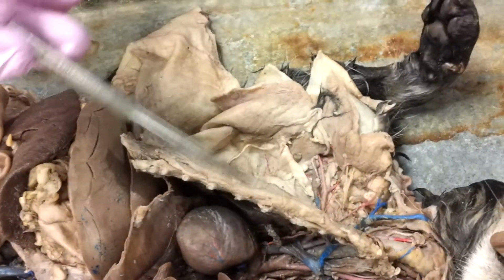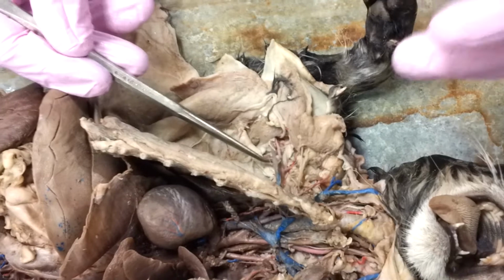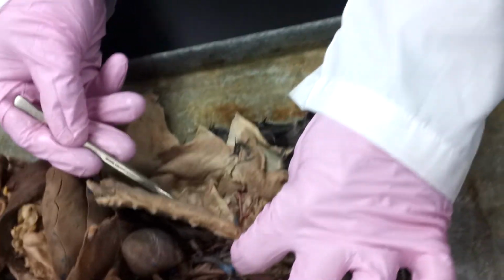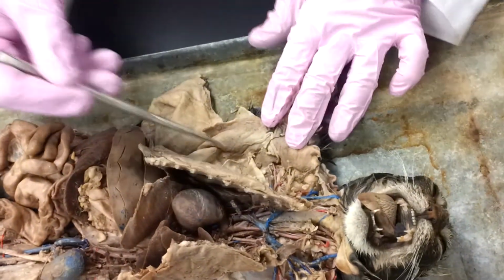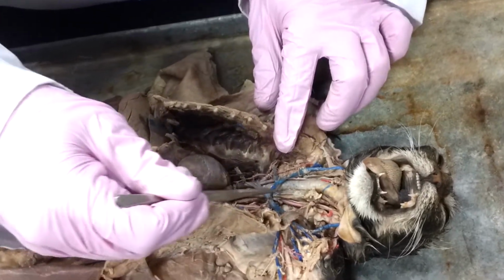How would I test on that? Well, I would have to make it real clear that I'm right in the middle of the arm, or I'd go right on the outside of the actual rib cage to show you axillary. I'd be on the inside to show you subclavian. I've got to make that real clear, though. Back to our brachiocephalic.